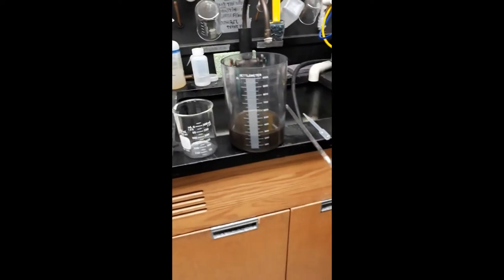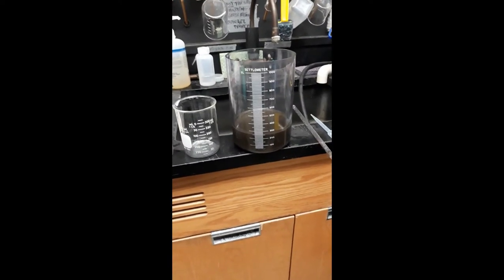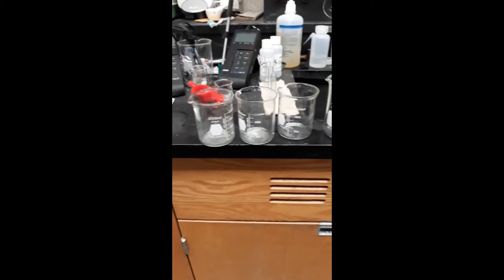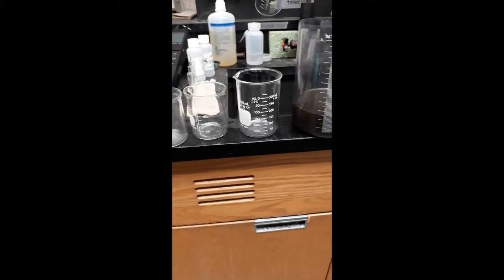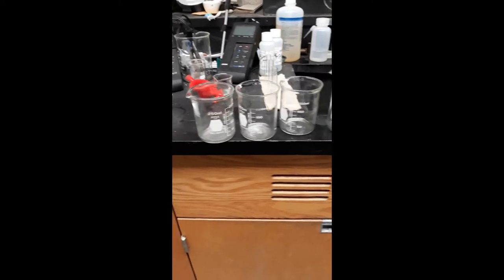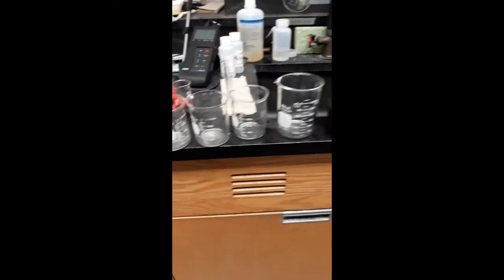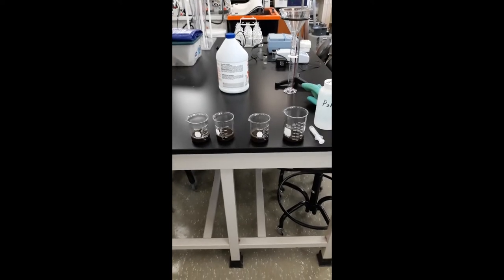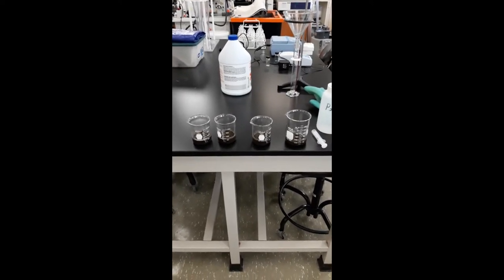Okay, what we're going to do now is transfer sludge from the thickener into our sample containers so we can work on it and condition them.